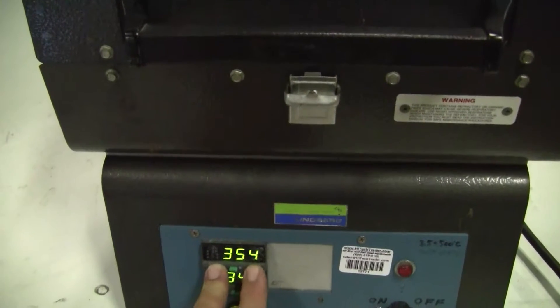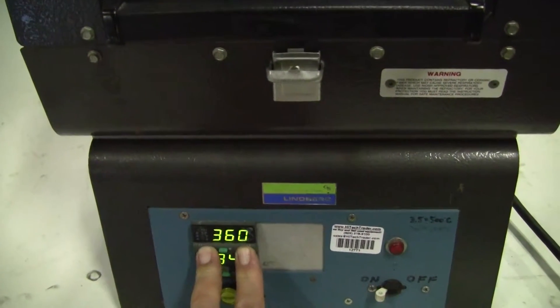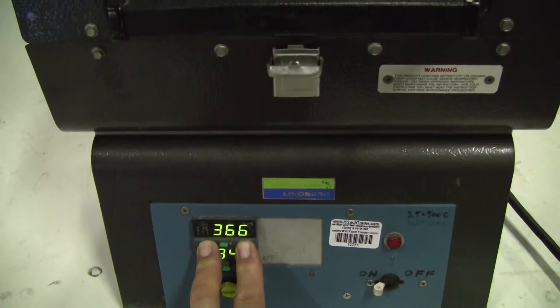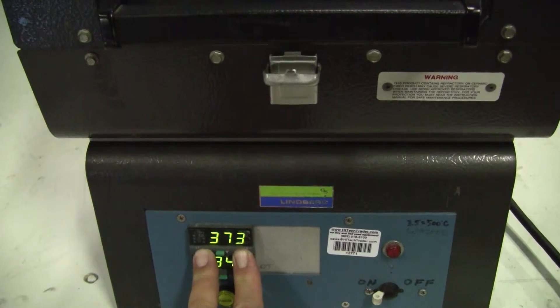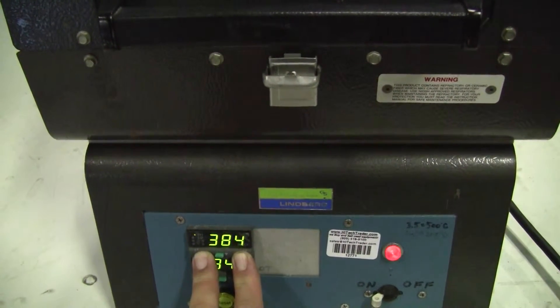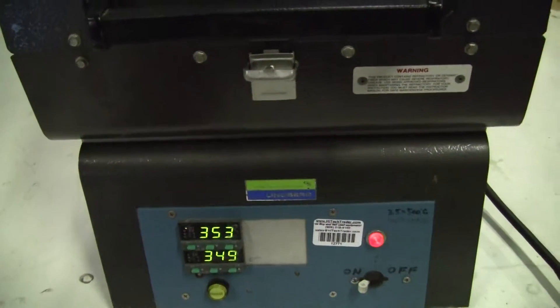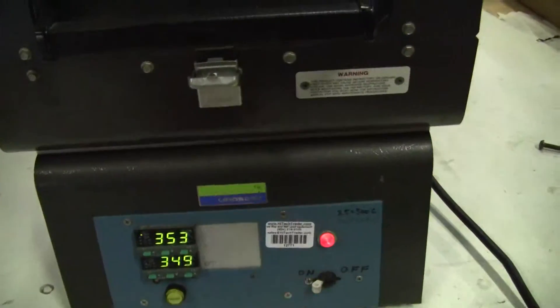So what I'm going to do is I'm going to drive the heat a little bit more. Okay. And you see the button.